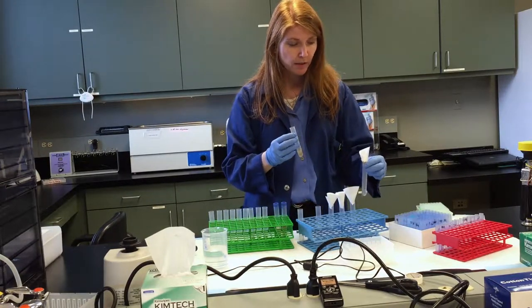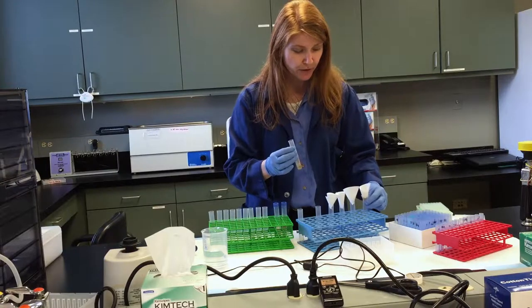So over time, this will slowly drip. The liquid will slowly drip down into the test tube.